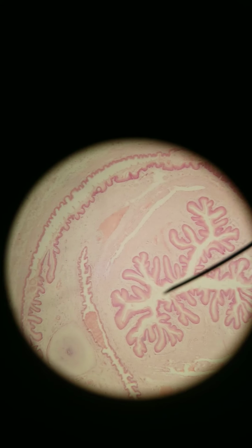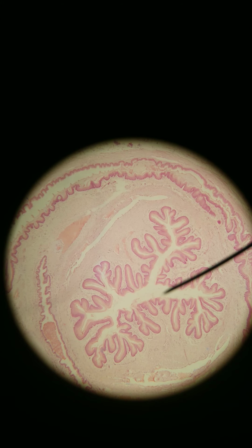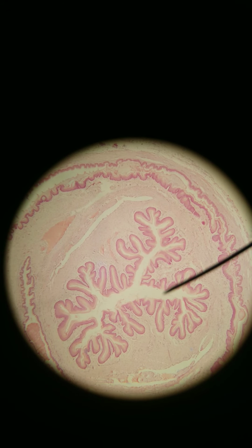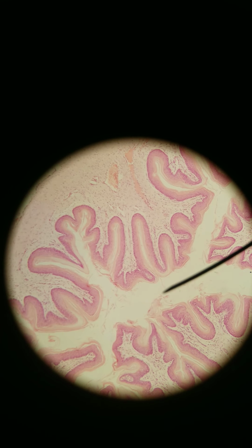In another video, I'll go over exactly the orientation of the penis here, but this weird fractally Y-shaped thing here, that's the urethra. The urethra is not just a round tube. The urethra is this complicated patterned space. So by the time we get to the outside, it's stratified squamous. We always want non-keratinized stratified squamous near the end of a mucous membrane so that we can protect ourselves from friction, from bacteria, whatever it is.